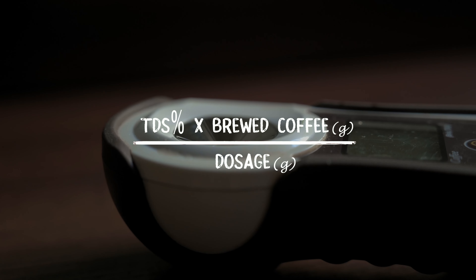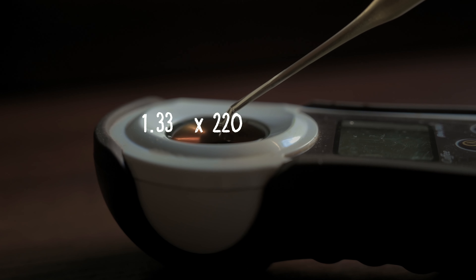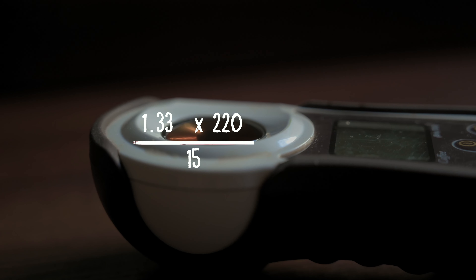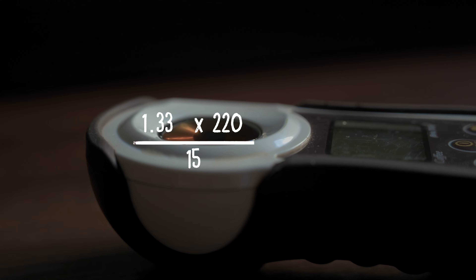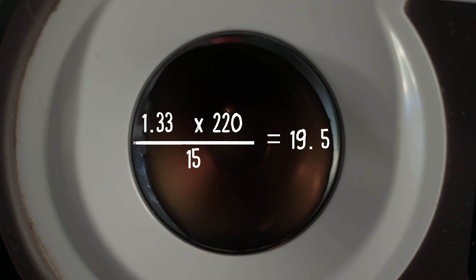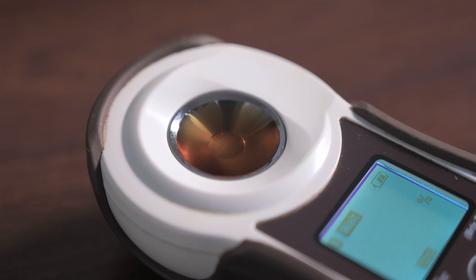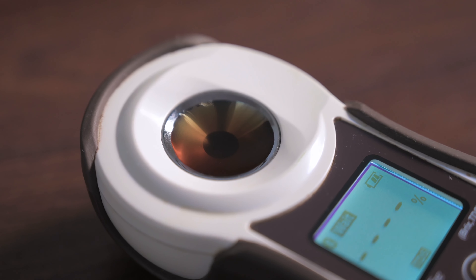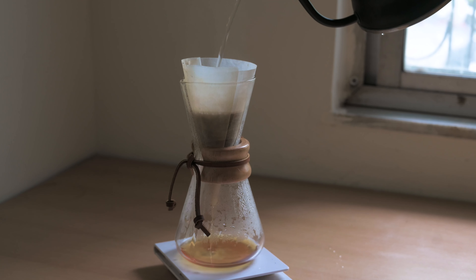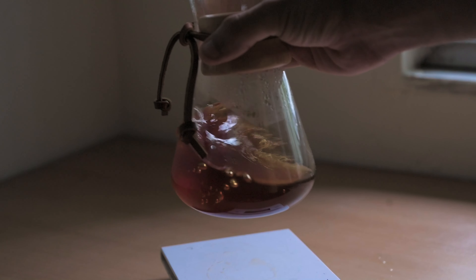What is happening is the light is being passed through the liquid. The reading that has come up is 1.33 percent — that's your reading. Now take the coffee off the lens — don't rub it too hard — then take the alcohol swab and wipe it down again. This is done to ensure there is no contamination from one coffee or any residue left.